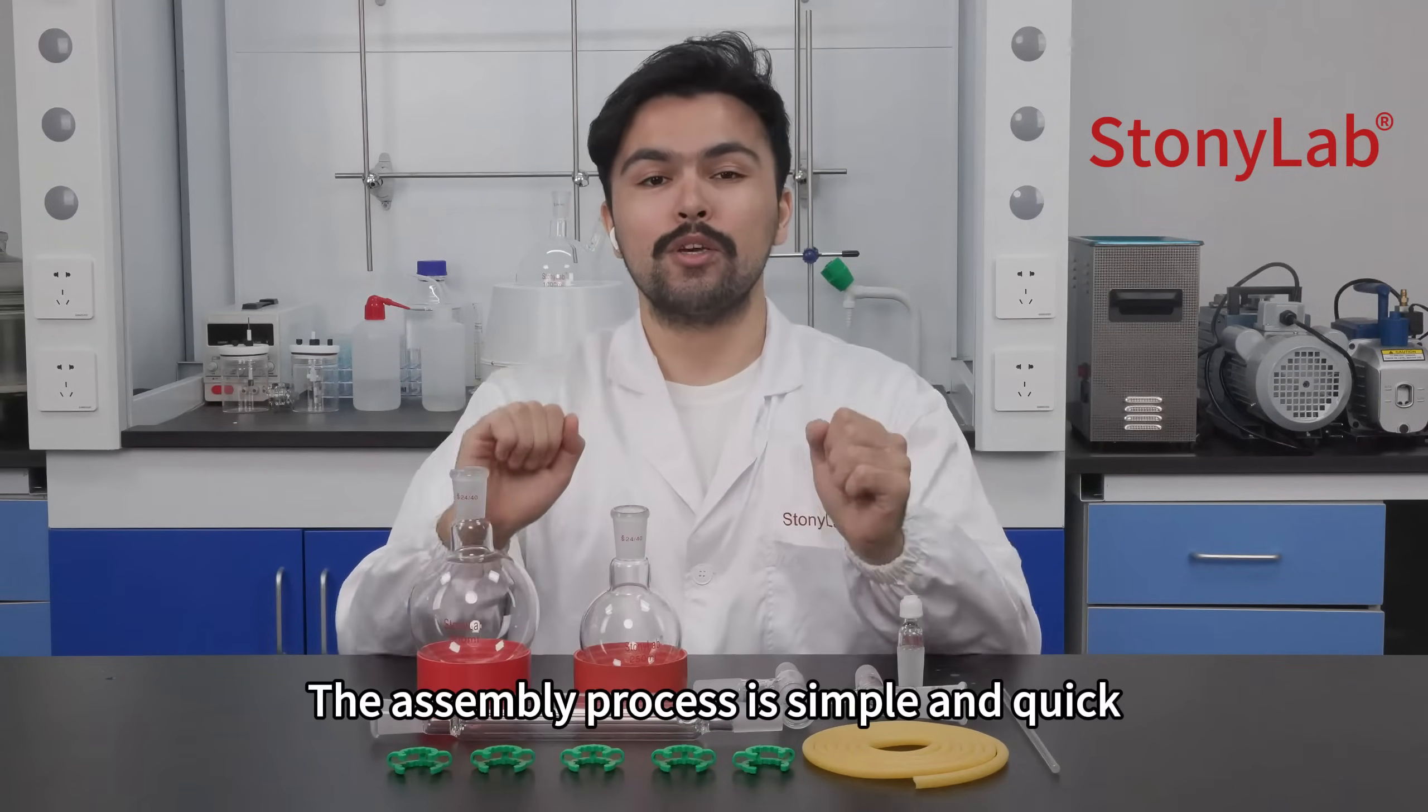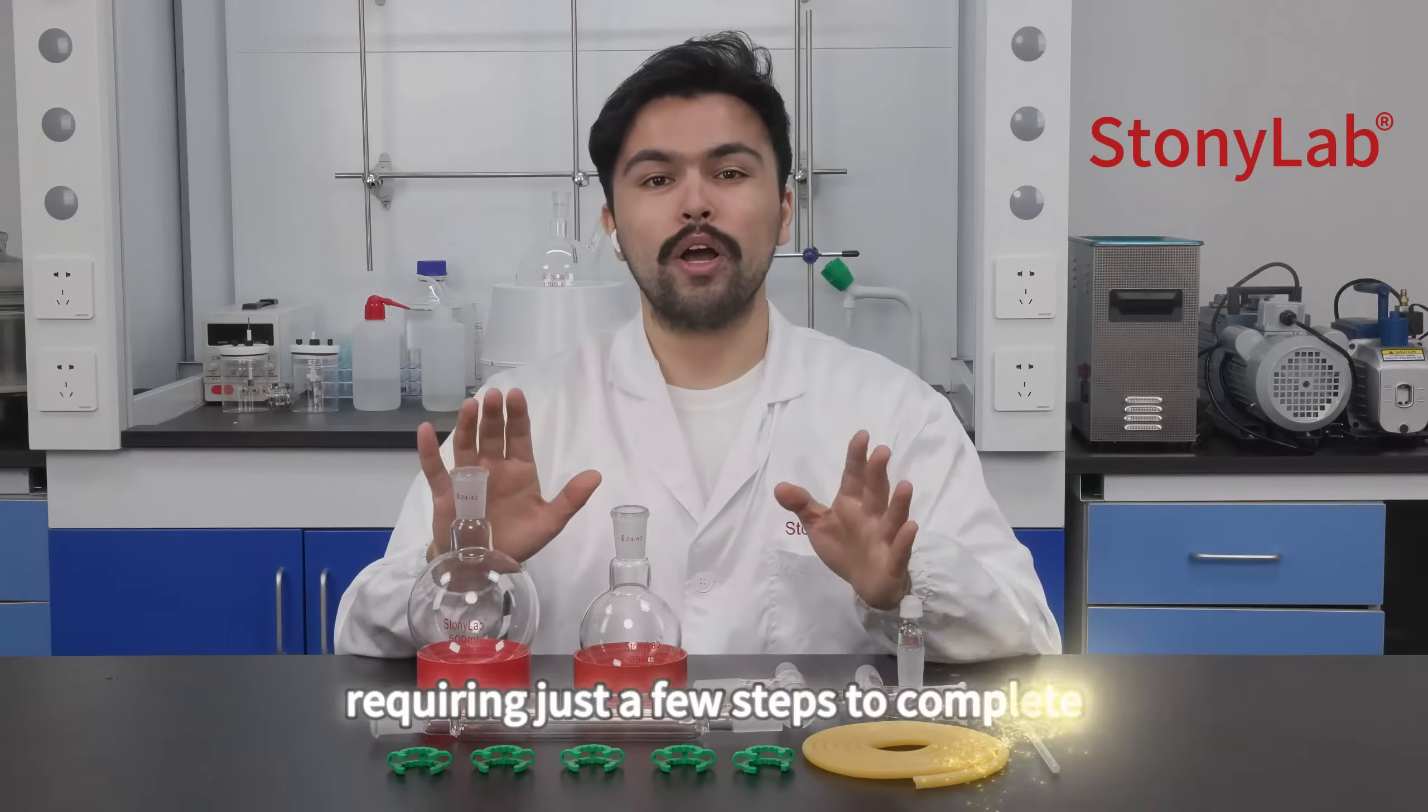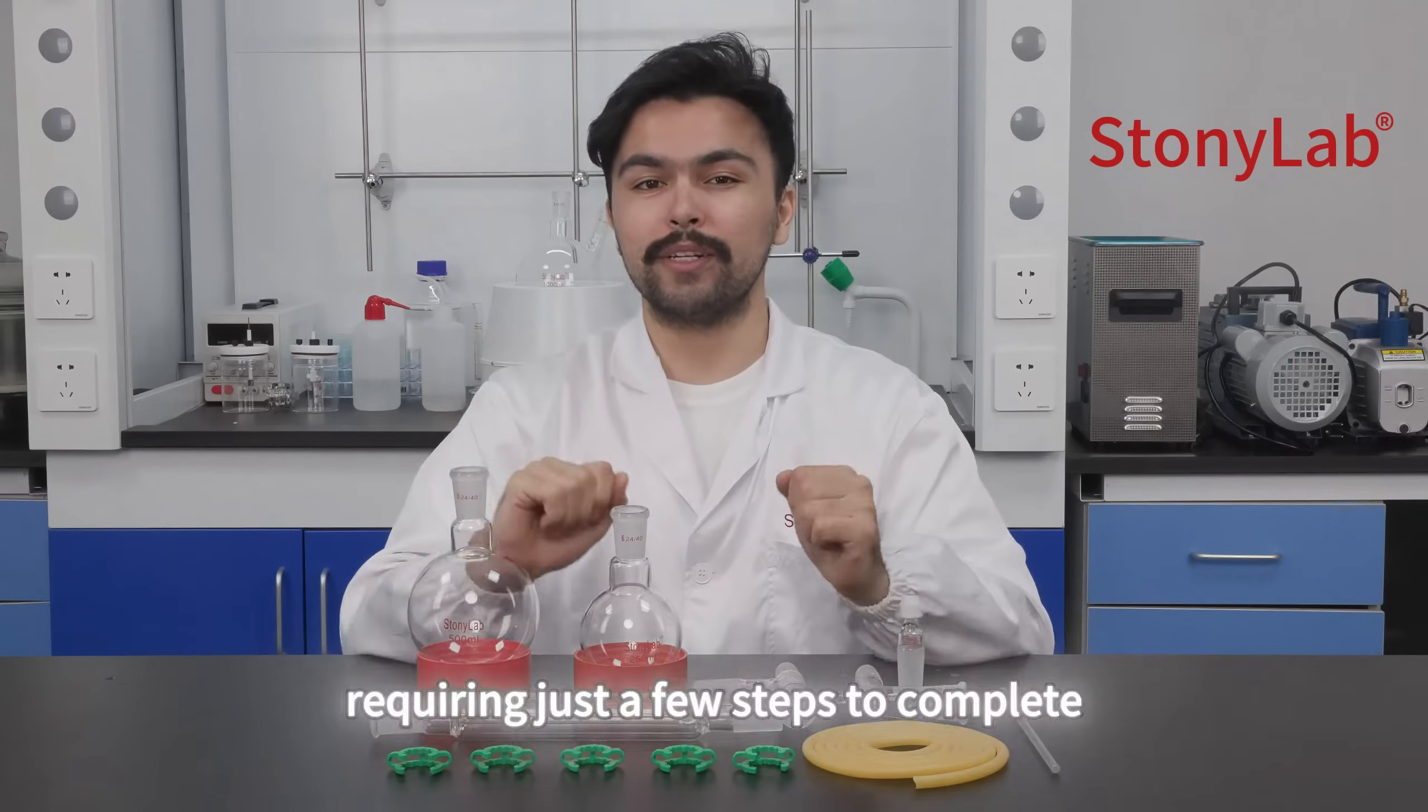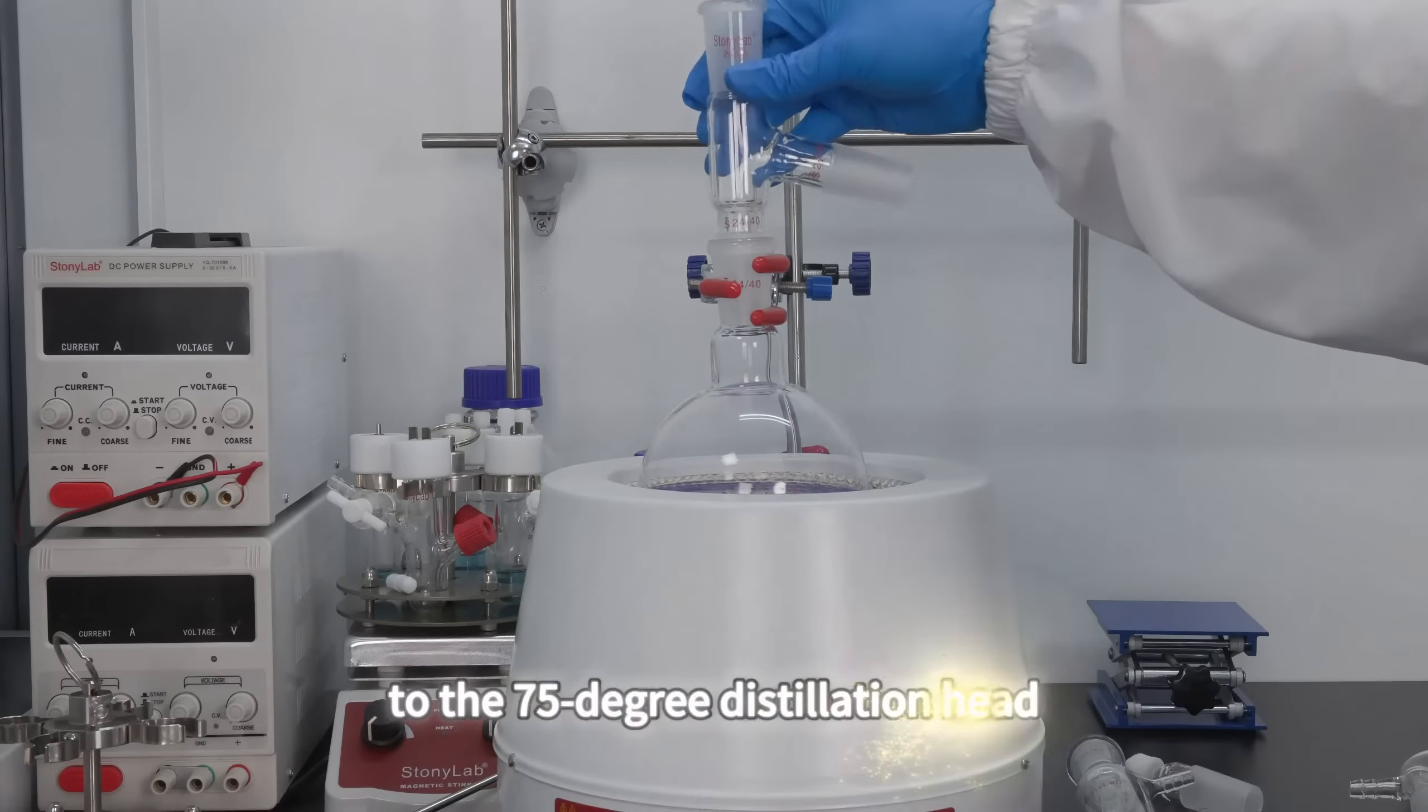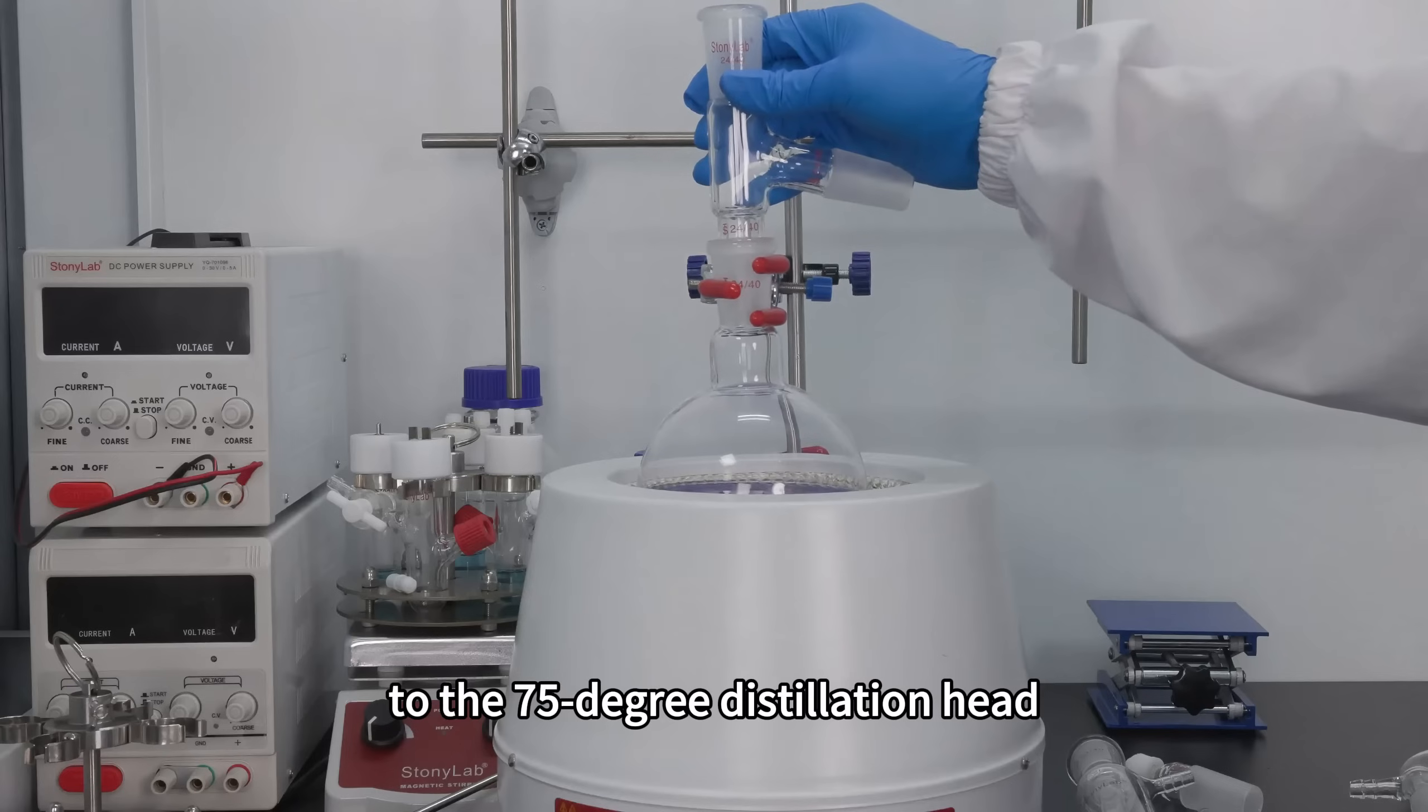The assembly process is simple and quick, requiring just a few steps to complete. First, connect the 500 milliliter round bottom flask to the 75 degree distillation head.